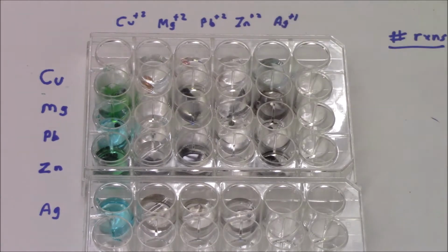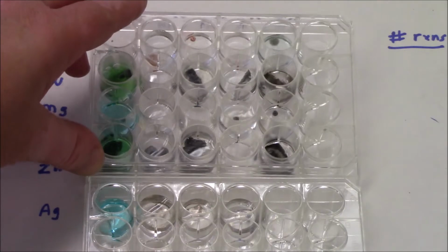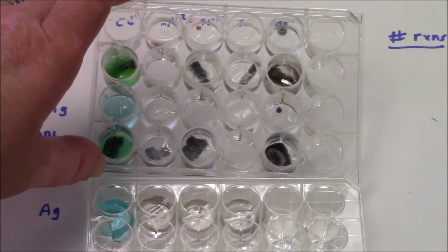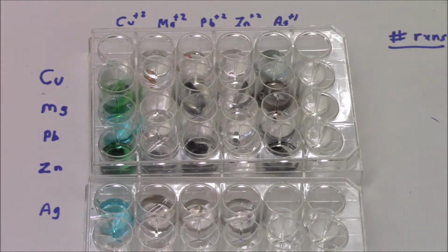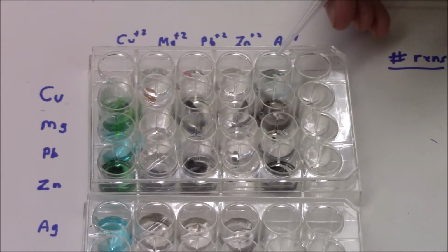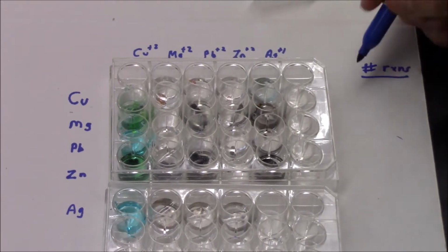But if you look in this one, it looks very much like your copper-colored pellet has been completely covered with a silver-looking metal. There's a reaction. And what you'll end up doing is putting a yes in that box. And then, for this one, you'll write the balanced equation. And if you're in honors, you'll write a net ionic equation for it. Okay? So copper reacted once. So I'm going to write a 1 for copper metal.